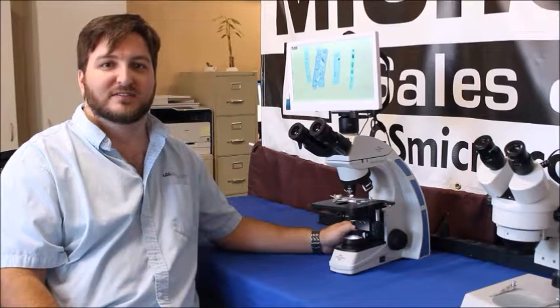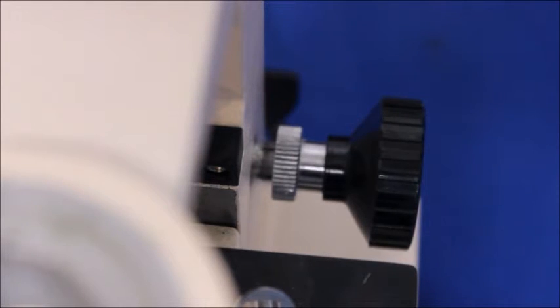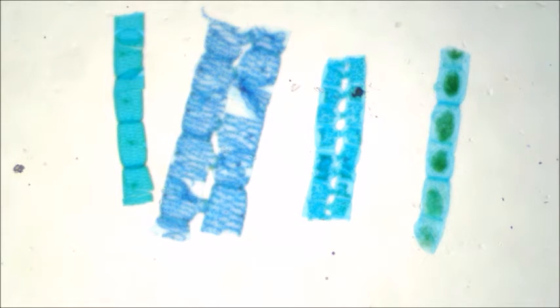Welcome back to LGS Microscopes. My name is Paul and today we're going to talk about focus tension. Do you ever have that problem that when you let go of the focus knob your image just suddenly starts to fall out of focus?